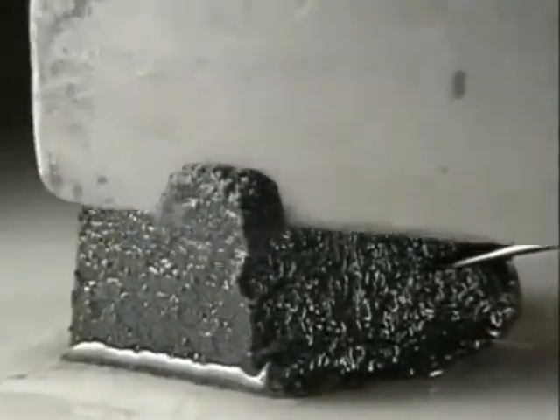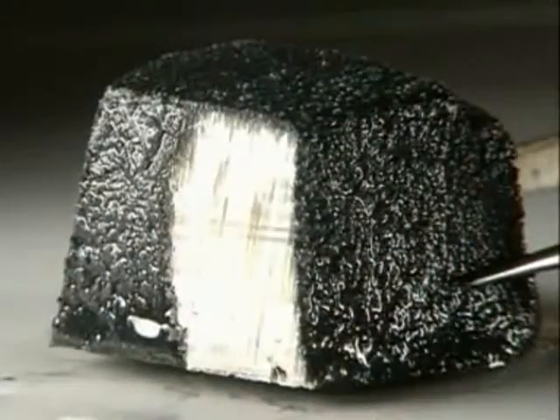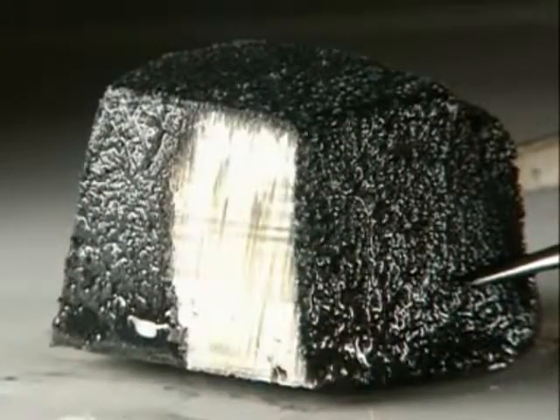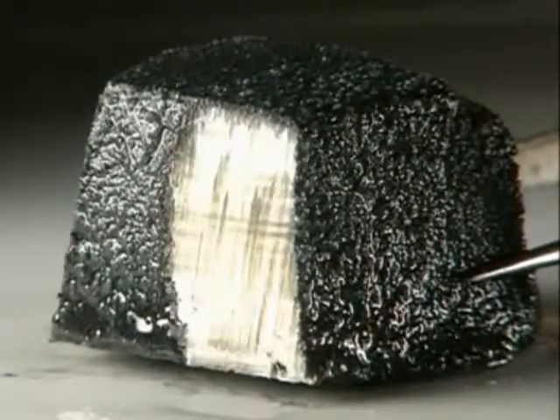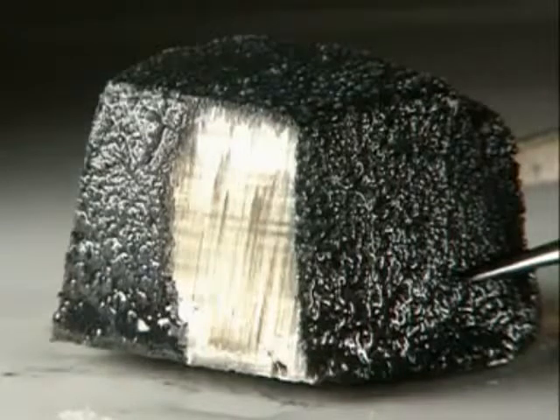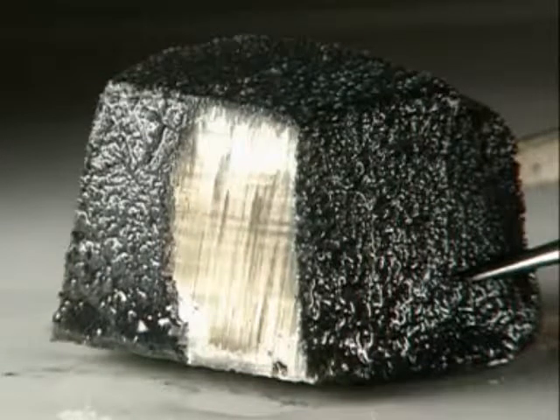Lithium is so soft, it can be cut with a knife. You can see how shiny the freshly cut surface is, but leave it exposed to the air for a few seconds and it quickly begins to tarnish. It's reacting with the air.